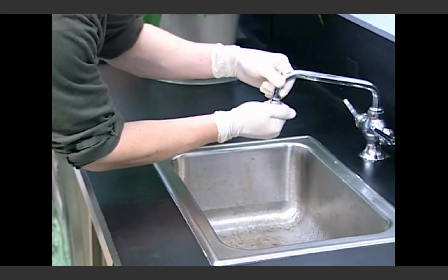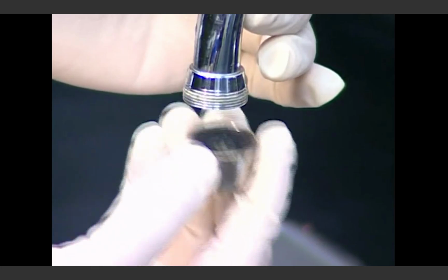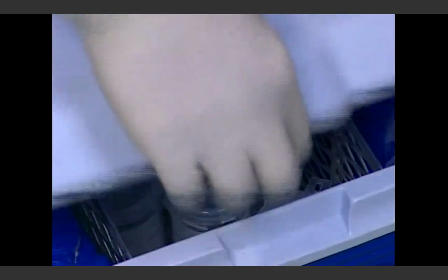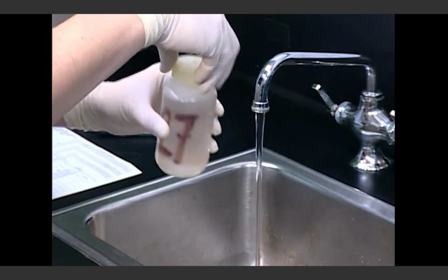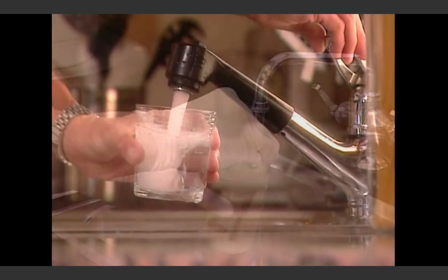An organized, efficient, and effective sampling program for total coliform is an integral part of a water supplier's toolkit in assuring the protection of the public health.